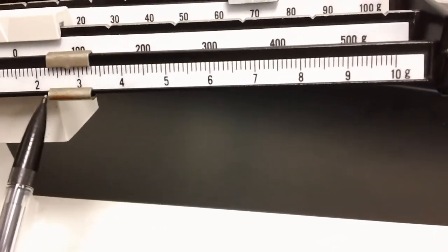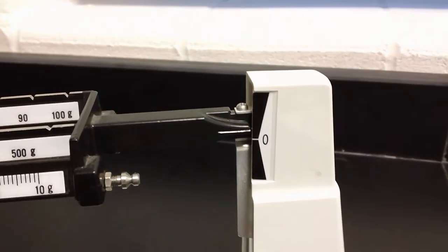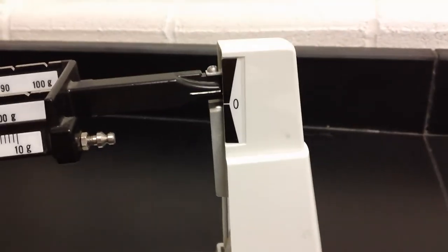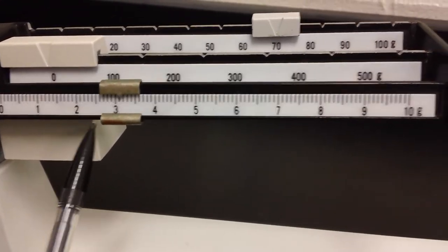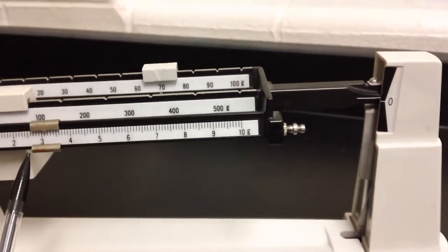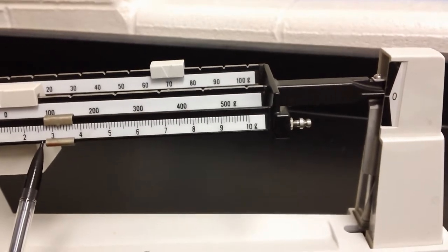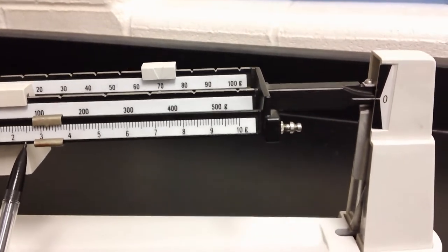There's 73. As you can see, we're starting to balance a little bit. Getting closer. Getting a little bit closer. Oh, that's very close.